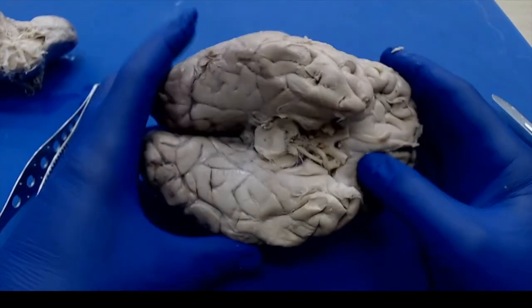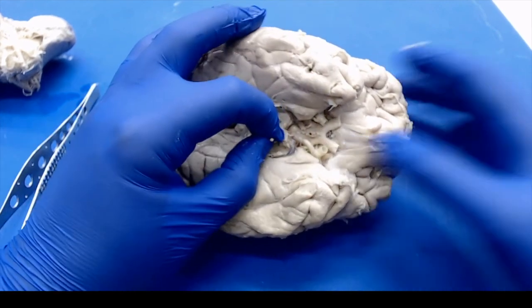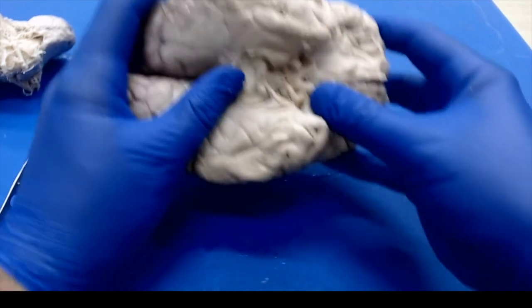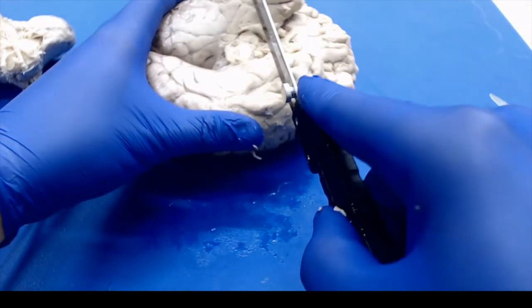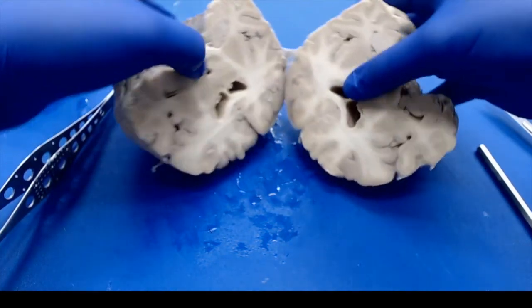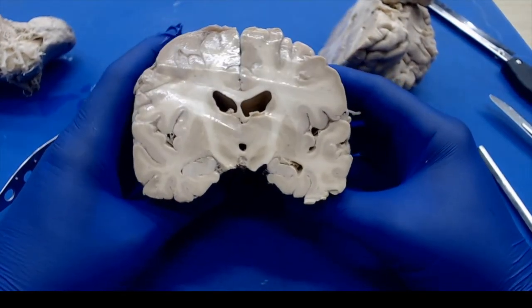All right, so the next step is I showed you those mammillary bodies on the circle of Willis brain. Now with the brainstem out of the way, we can see them right here. So we're going to use that as our cutting point. So go ahead and take your long blade, line it up with the mammillary bodies, and make a nice smooth cut through the brain. Now we haven't looked at the frontal cuts yet, but here is pretty much a lot of your cerebrum sections that you're going to want to be taking.